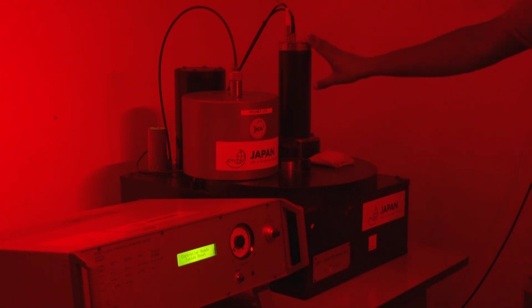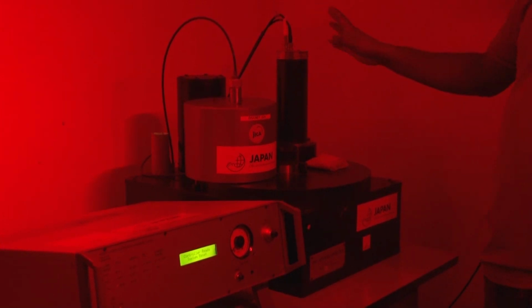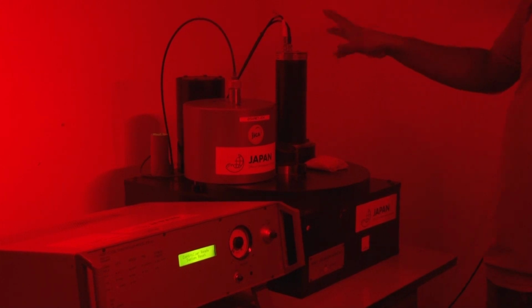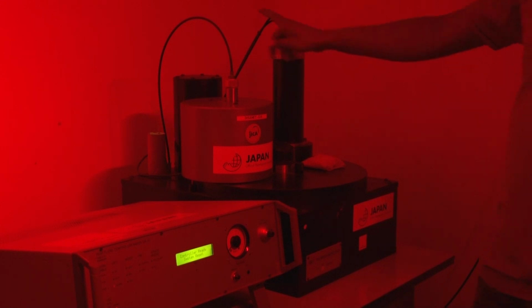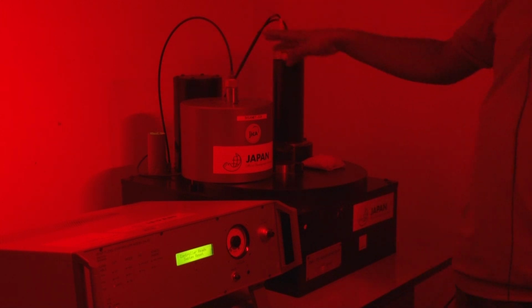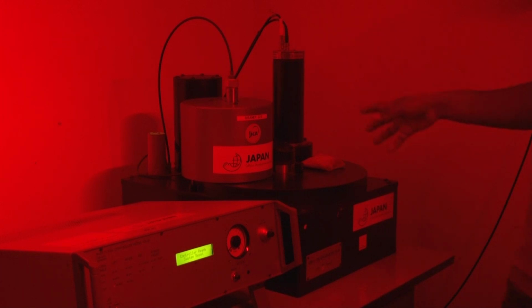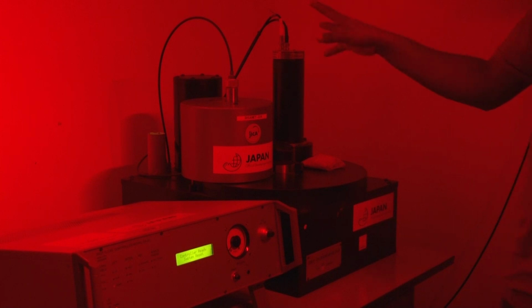So this is basically associated with the LEDs and the filter, which we use for the stimulation of the quartz and feldspar sample. I will come to this part later. The third one is your PMT, the photomultiplier tube. This is the detector. Ultimately all your photons or electrons are detected by the PMT, and you can see this data as a photon count on your screen.